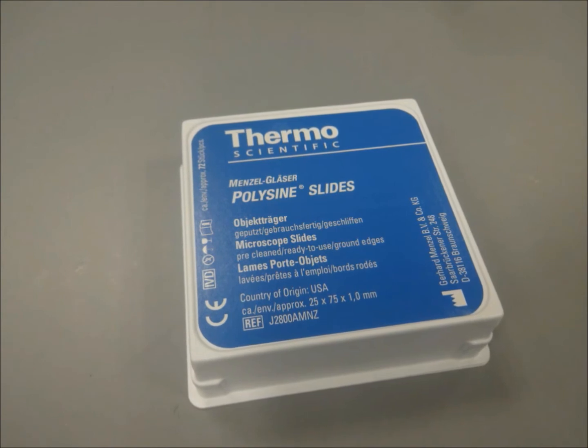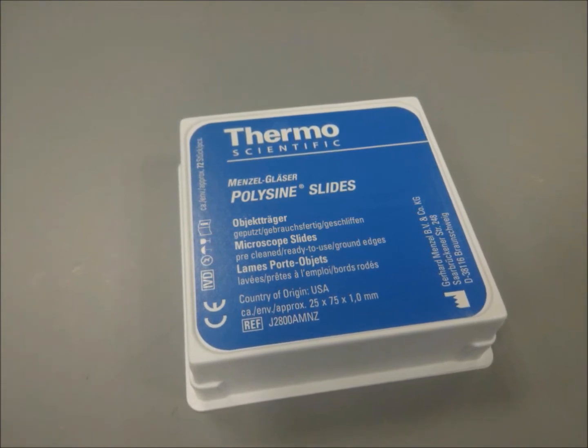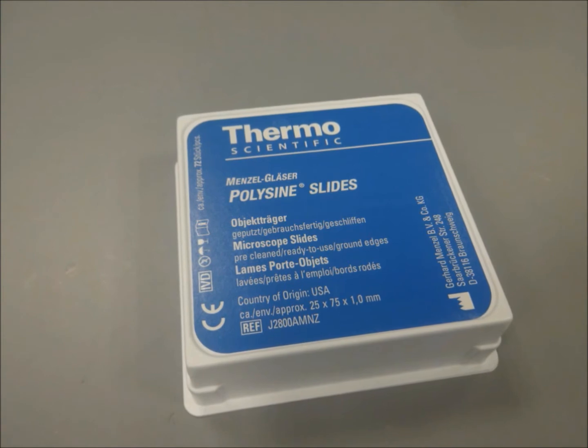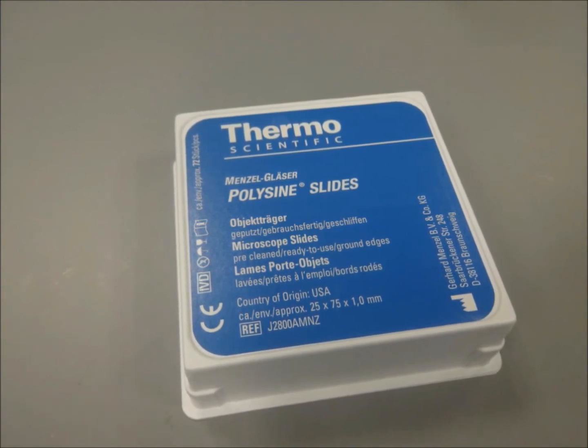Poly-L lysine coated on the microscope slide will enhance electrostatic interaction between the negatively charged ions of the cell membrane and the glass slide.